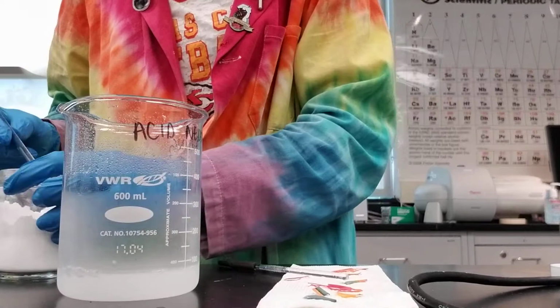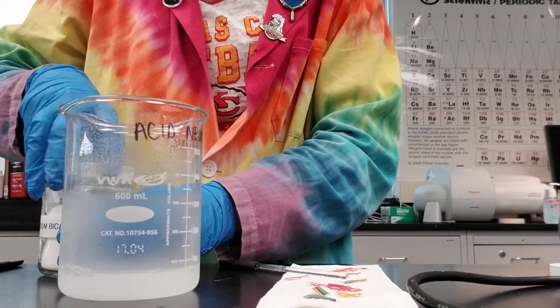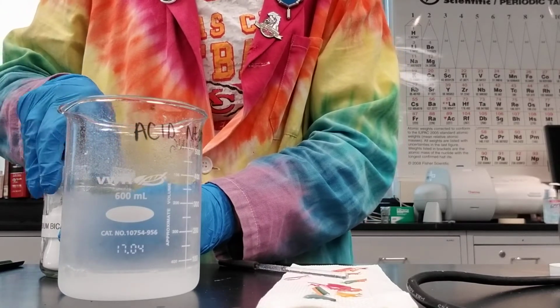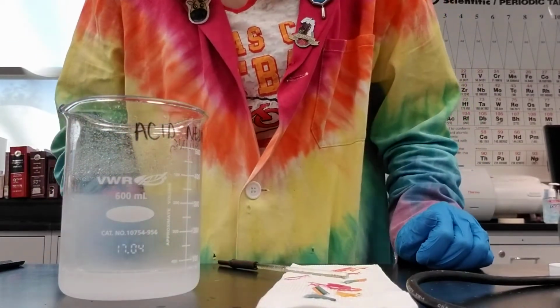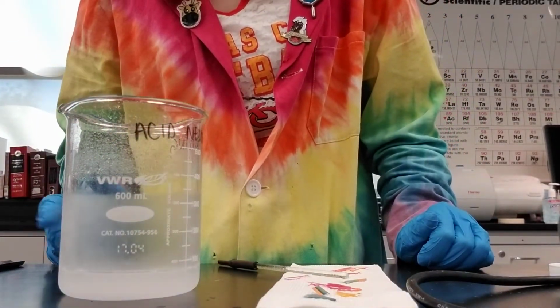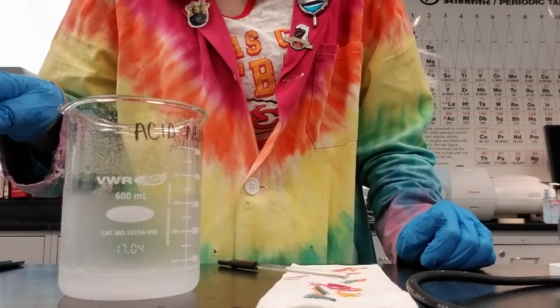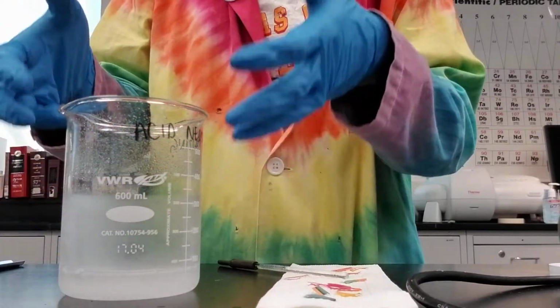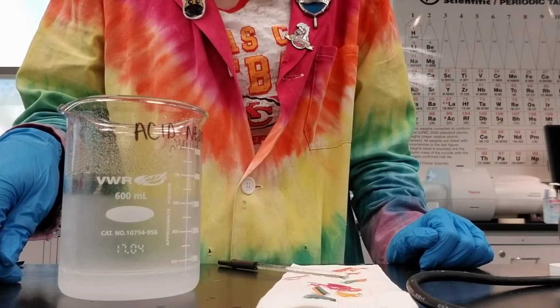When we're using the sodium bicarbonate, it's very, very difficult to go past the 9 value to where it becomes too basic. But if that were to happen, where you kept adding the baking soda and the pH got to 10, then we would need to turn around and add more acid to get the pH to a value of 6, 7, 8, or 9. Just be careful not to let this bubble up over and make a mess, and just periodically check on your solution.